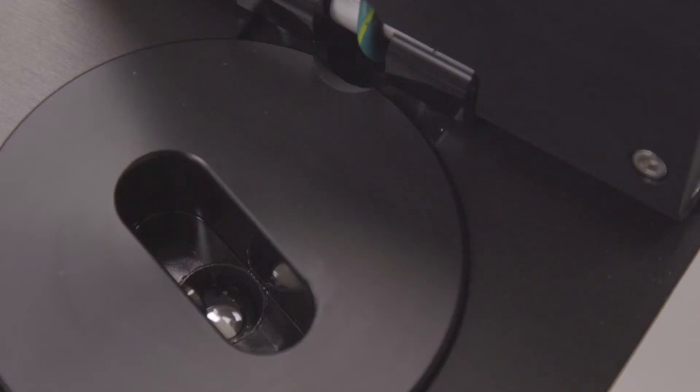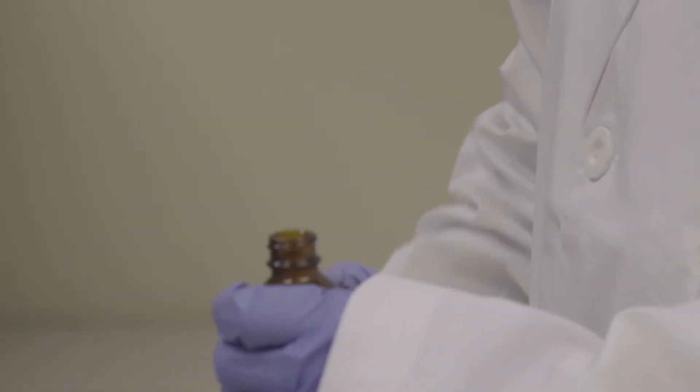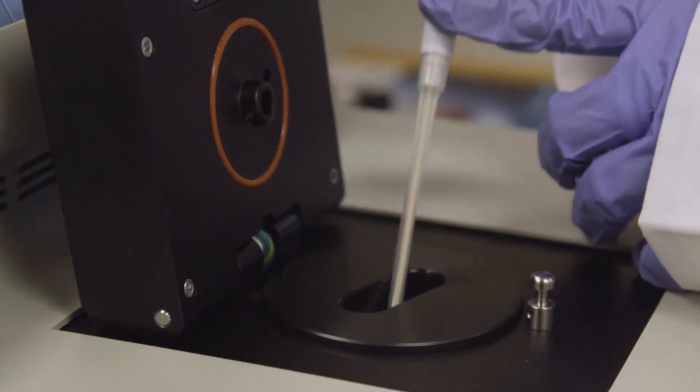Check if any bubbles are present in the test aliquot in the sample cup. If yes, burst them with a pipette tip or replace the sample entirely.